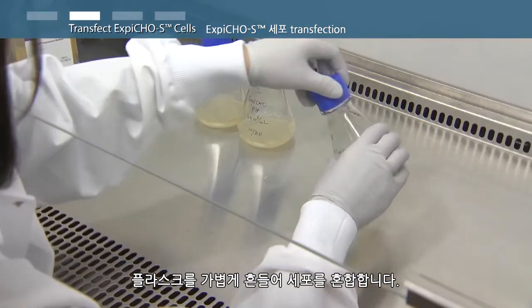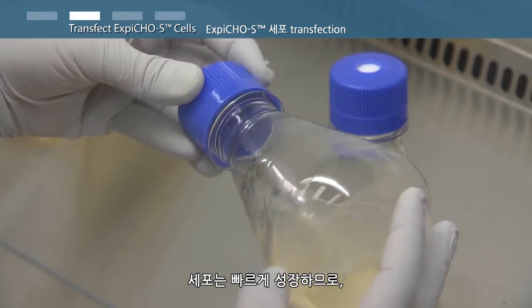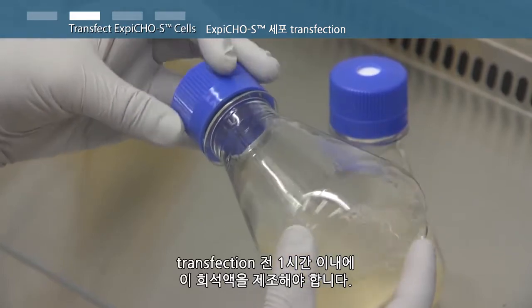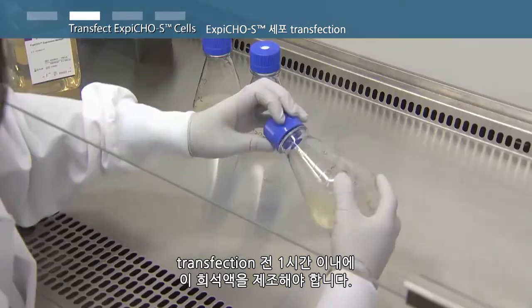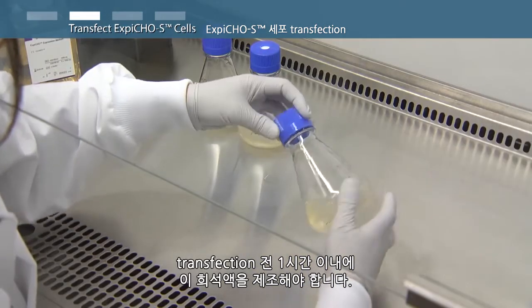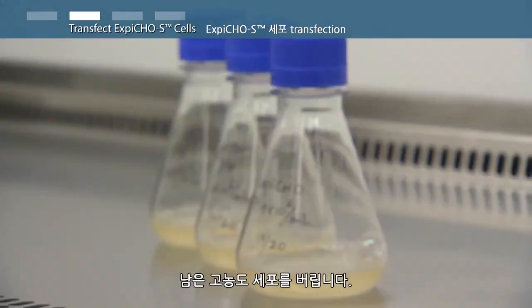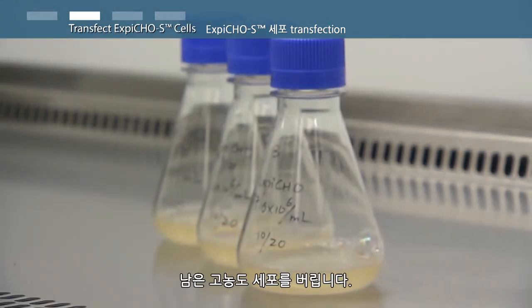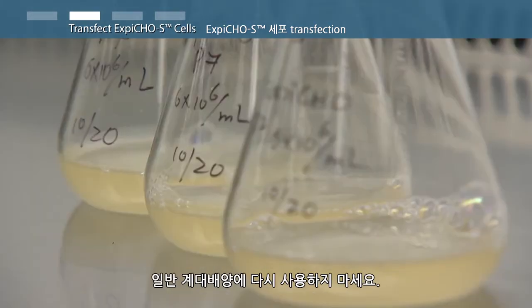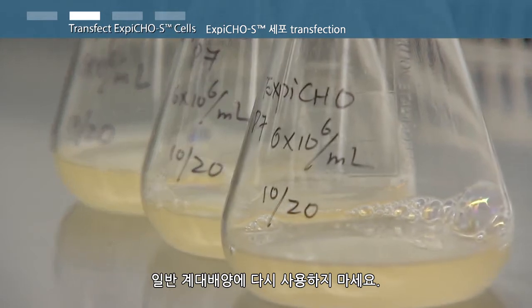Swirl flasks gently to mix the cells. The cells do grow fast, so only make this dilution within an hour or less prior to transfection. Discard any remaining high density cells. Do not reuse for routine subculturing.